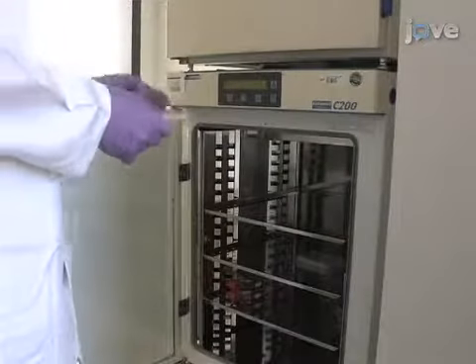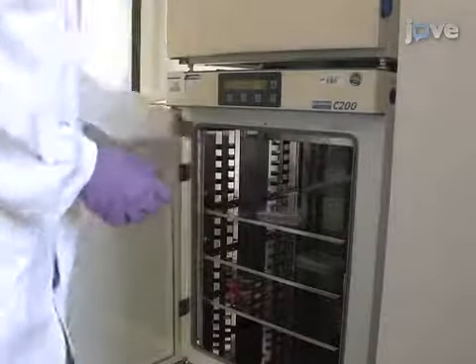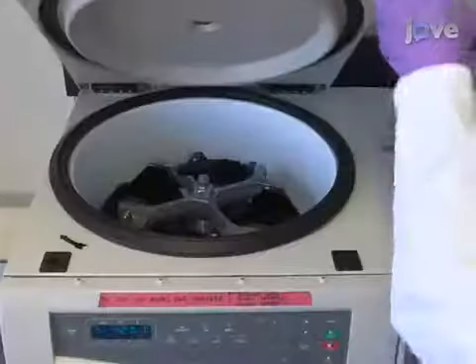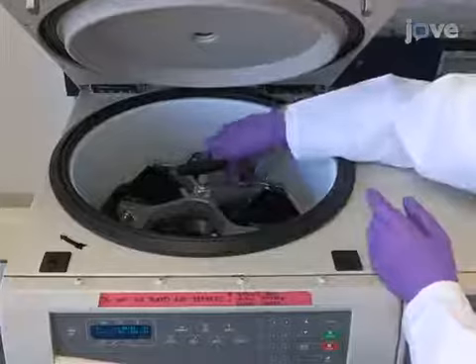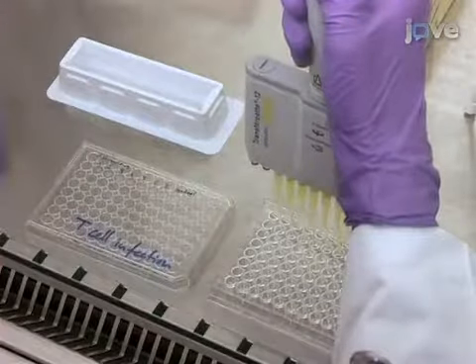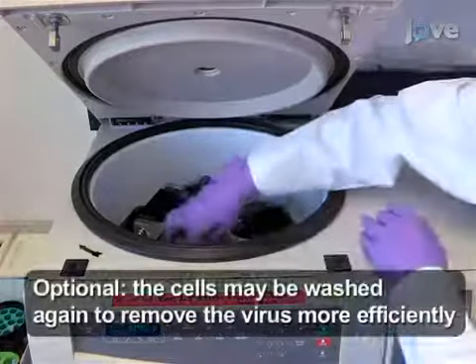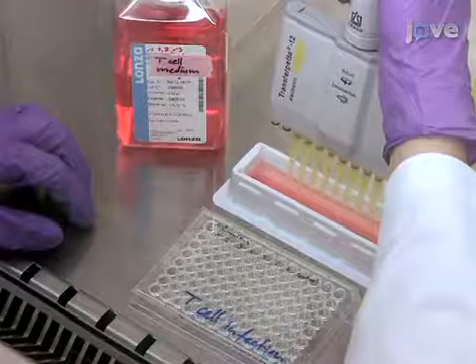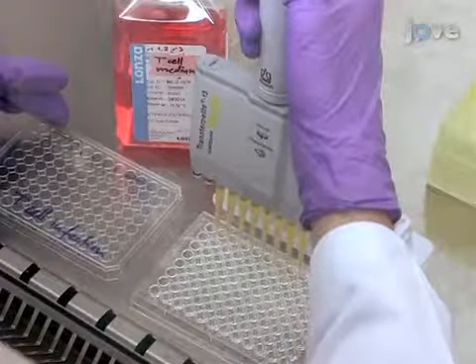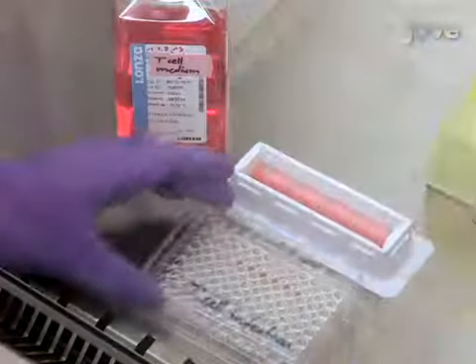Incubate cells for 90 minutes at 37 degrees Celsius in a 5% carbon dioxide incubator. Following the incubation, spin the cells down at 300 G for 5 minutes at room temperature. After the spin, resuspend them in 200 microliters of PBS. Centrifuge again and take off the supernatant. Resuspend cells in 200 microliters of T-cell medium without stimulating antibodies and without IL-2 or other cytokines.